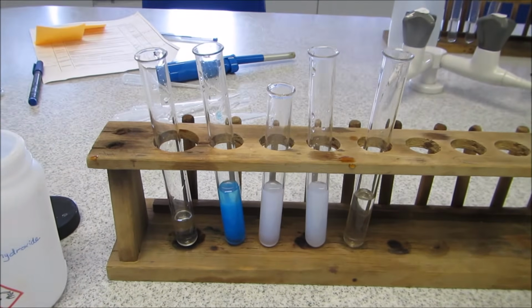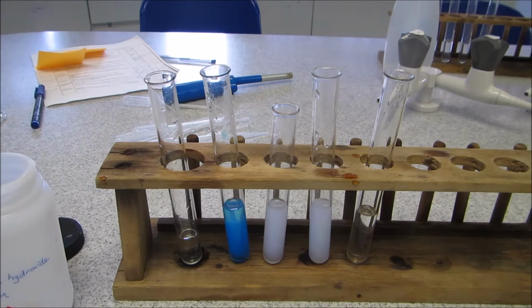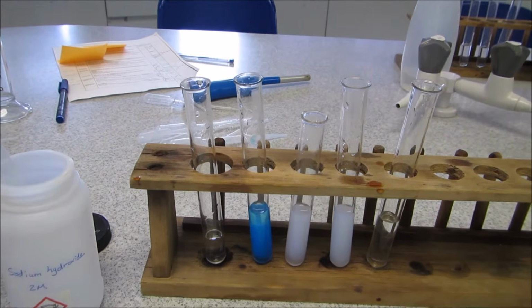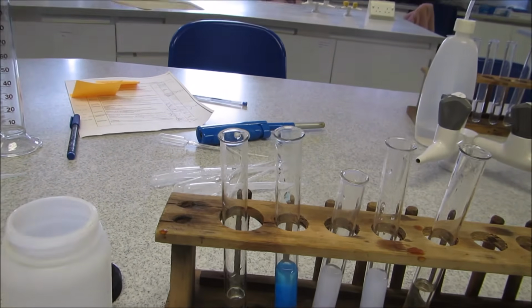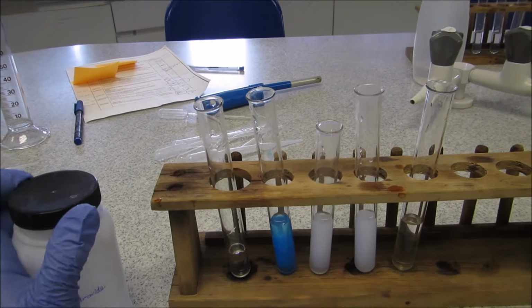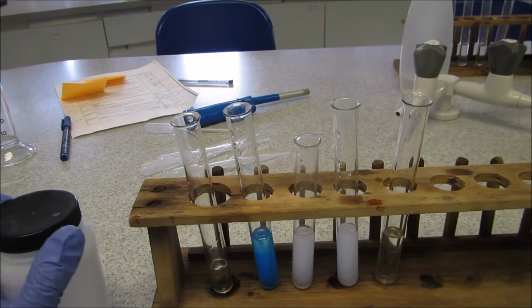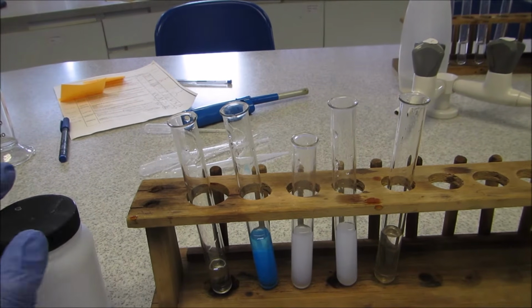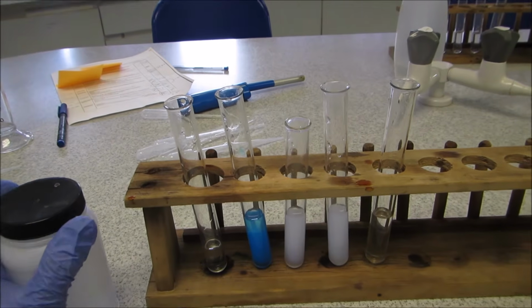You would now do flame tests to work out what color each one is. Because the flame tests don't show up particularly well in a video, I'm just going to tell you some of that information. So for the first one, the flame test should be yellow. The second one should be blue-green. The third should be a brick red. The fourth, a light green. And the fifth one, lilac.